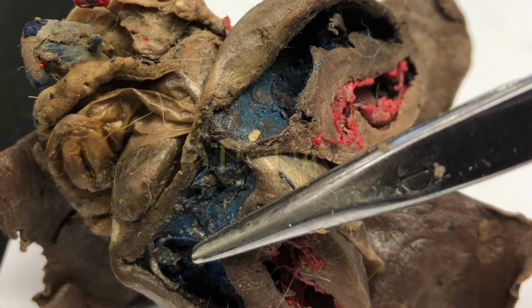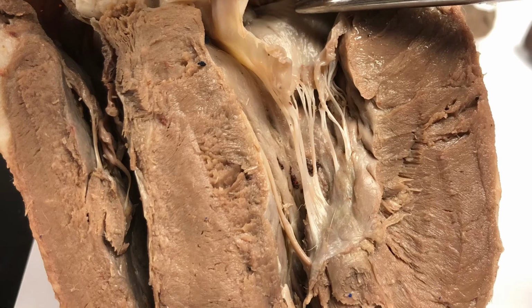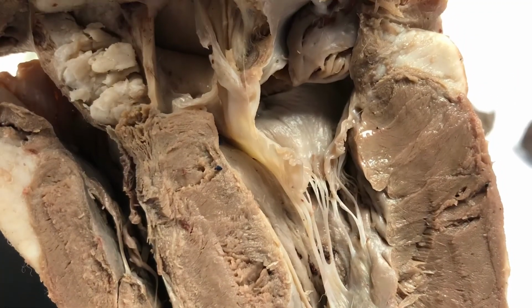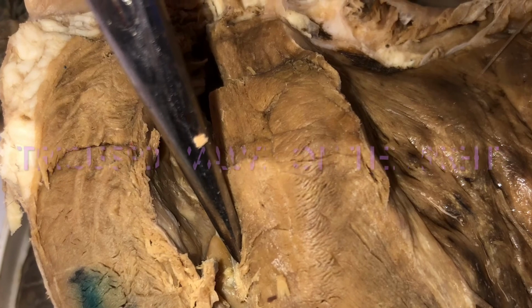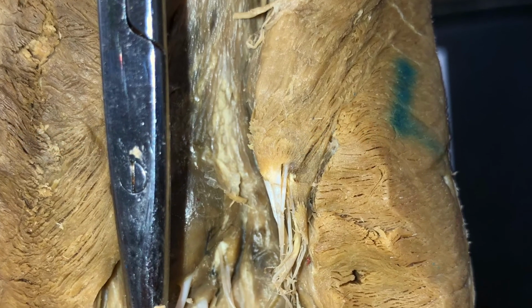Here's the atrium again, those upper chambers of the heart. Atrium. The tricuspid valve then on the right, and the bicuspid valve on the left.